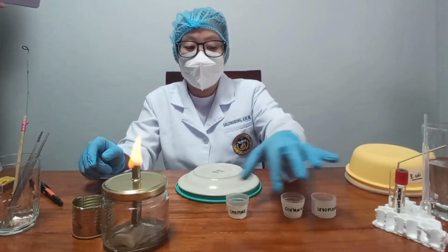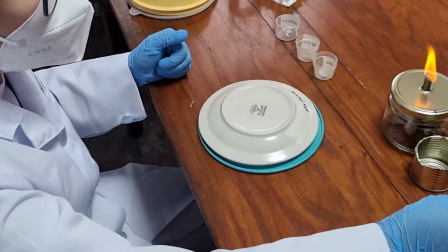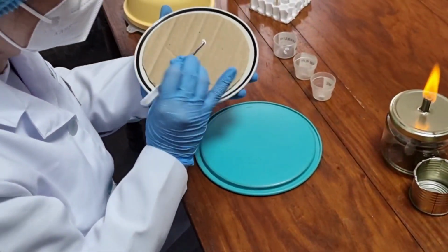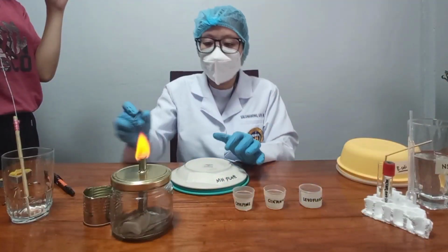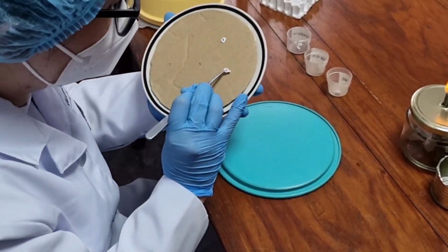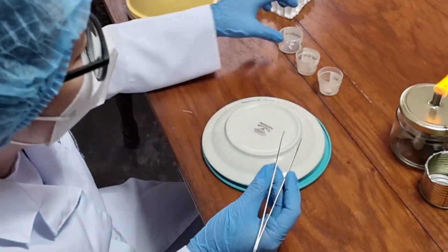Once the MH plate is prepared and all set, put in place the antibiotic discs. Use forceps in dispensing the discs and do not forget to perform aseptic technique before and after usage. In the placement of the discs, make sure to provide enough space between them.